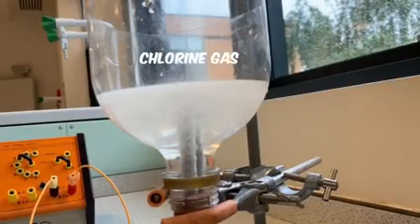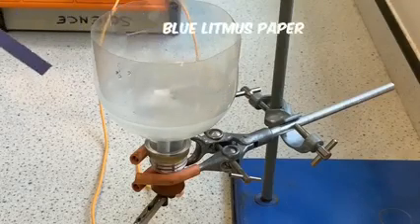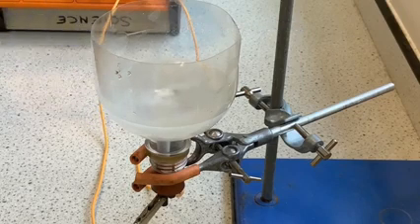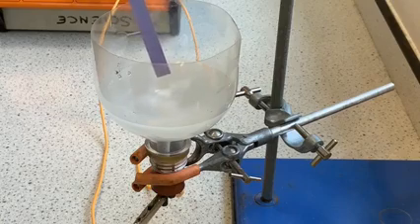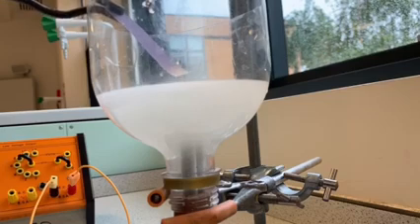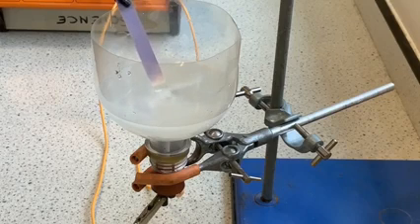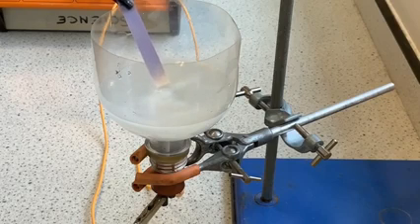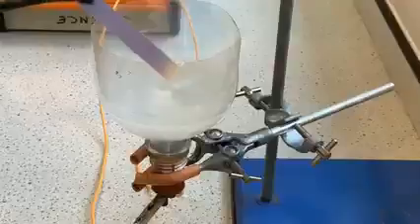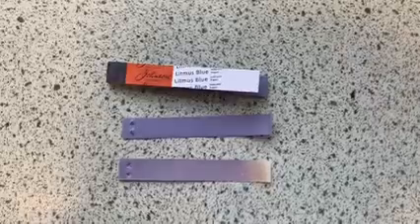What is the test to prove that it is chlorine gas? Well, we use a piece of litmus paper. And in this example here, I've got some blue litmus paper, which first of all we dampen, and then we hold it next to the chlorine gas. Gradually what happens is it will go slightly red in colour, and then it should start to bleach. In other words, it should start to go white. And if you look just at the end there, you can see it is bleaching it a white colour. So we can see the bleached white section and the slight red section over there compared to normal litmus paper.